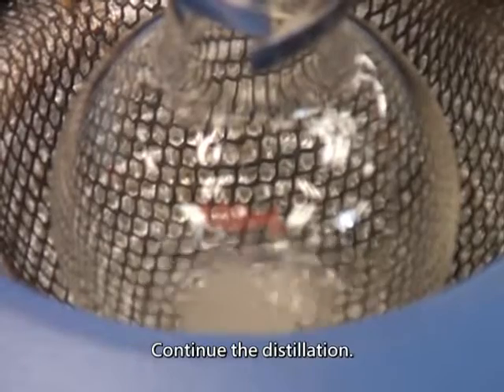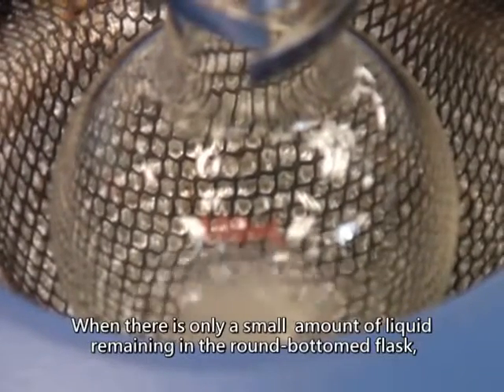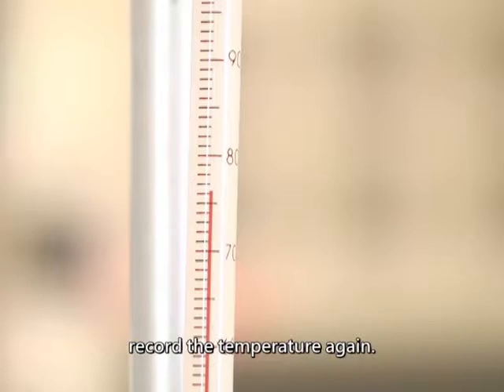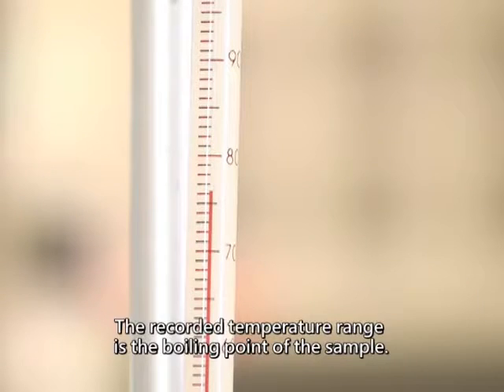Continue the distillation. When there is only a small amount of liquid remaining in the round bottom flask, record the temperature again. The recorded temperature range is the boiling point of the sample.